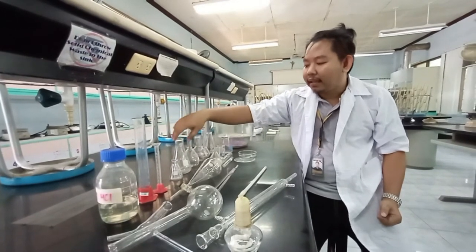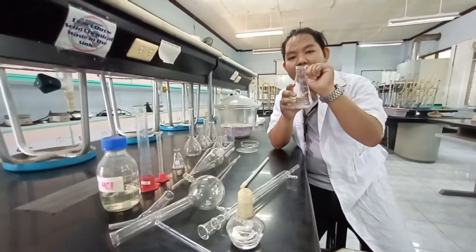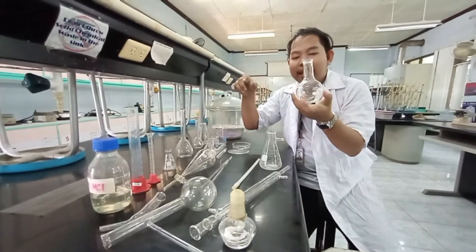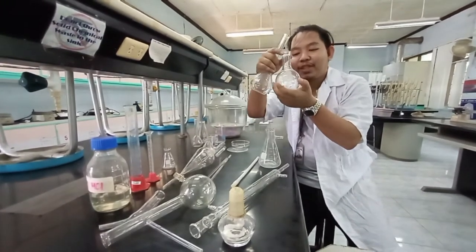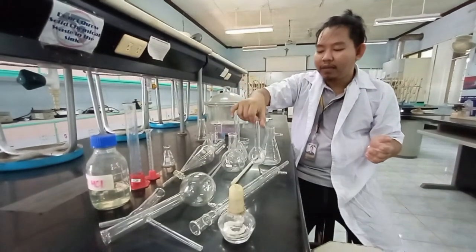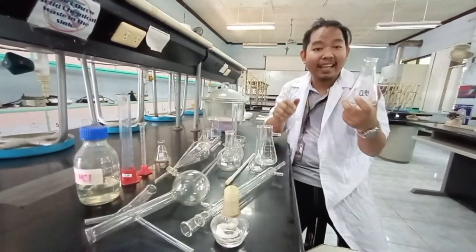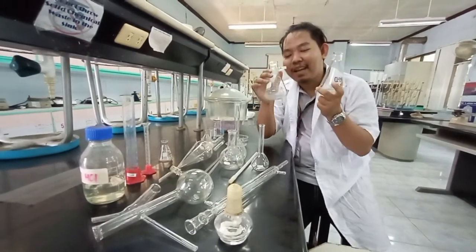And then we have here the filtering flask — it looks like an Erlenmeyer flask but with a hole on the side. So this is your filtering flask. Remember the differences. We also have Florence flasks — one short and wide, one tall and thin. These are your different flasks. And again, the Erlenmeyer flask — don't confuse it with the filtering flask. Filtering flask, Erlenmeyer flask — don't get confused.